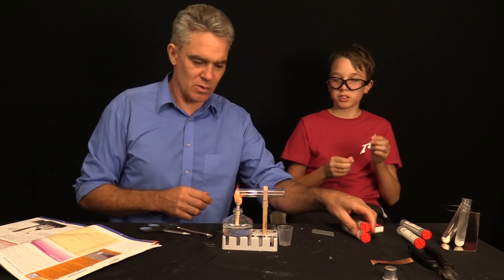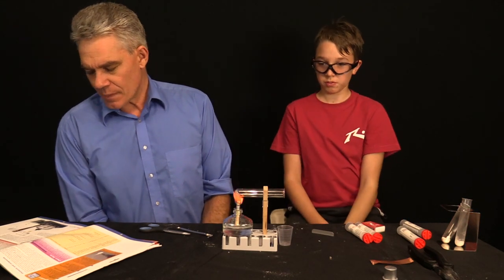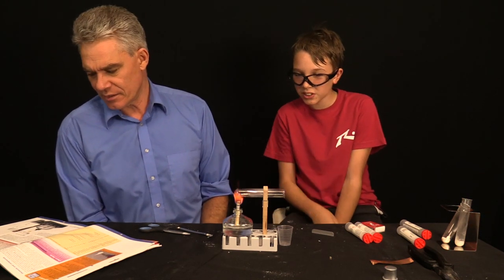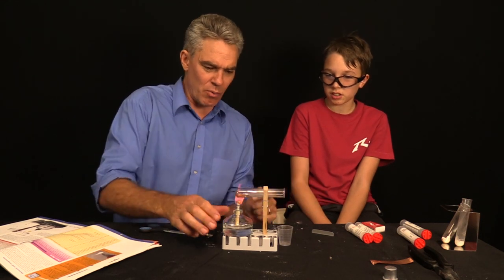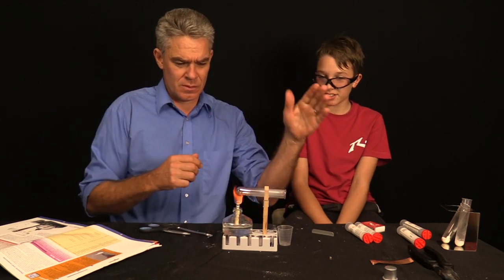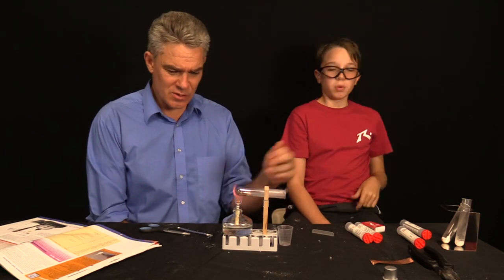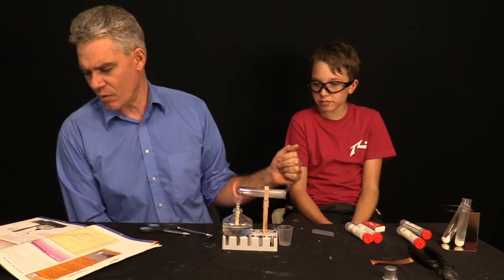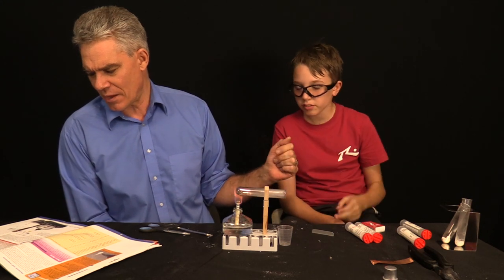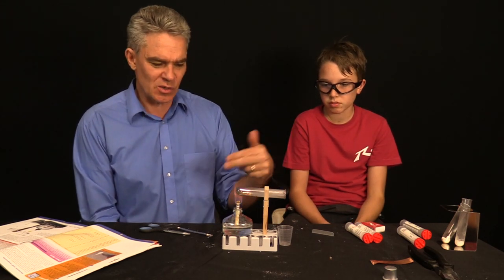Can I light it? You can light it, mate. You light it up. And let's see what happens. It says, this is what it says. I can see some melting and that sort of thing. It says, clamp the test tube at a slight slant with its open end down. The crystals are getting boiling. Look at this.